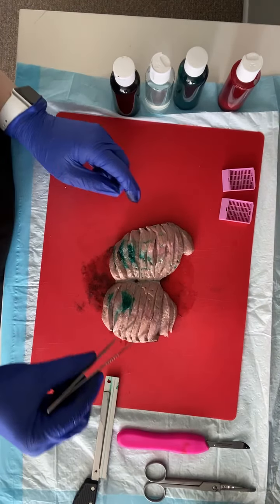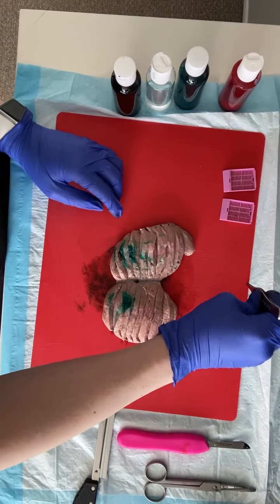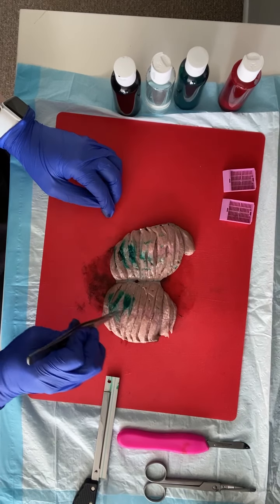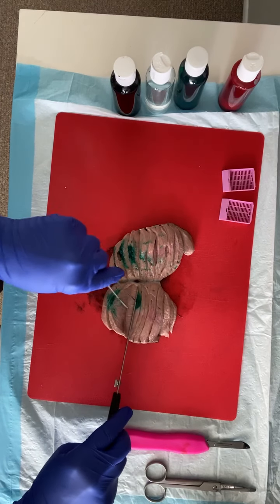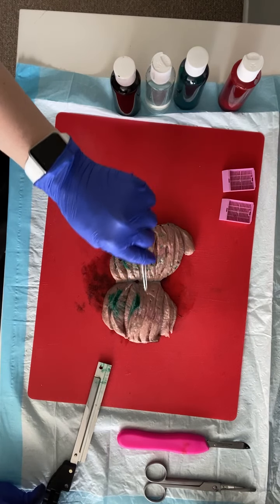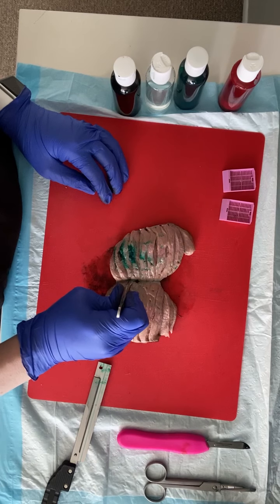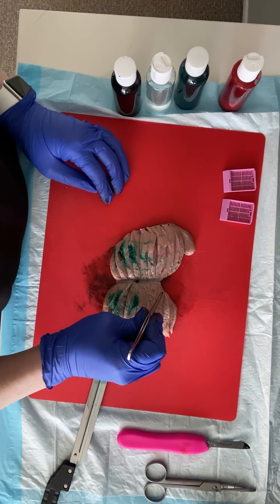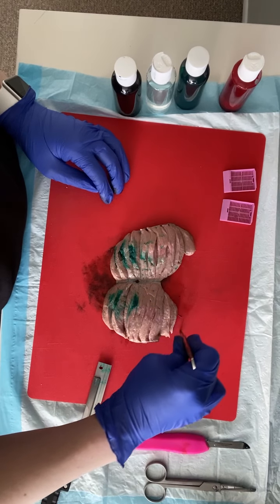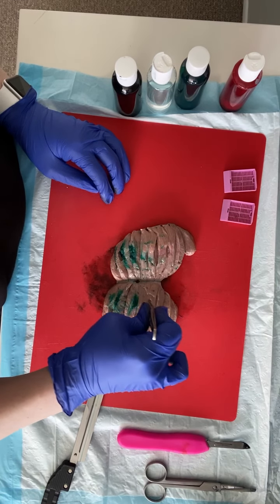We would measure three dimensions of our lesion. We would take the distance to our spermatic cord margin and also to our epididymis. Other important relationships: our lesion to the tunica albuginea — remember there's tunica albuginea all the way down through all of our serial sections, so make sure that's not your closest measurement; look at all of your slices. Important distances: tunica albuginea, epididymis, spermatic cord margin, and where testicular parenchyma goes into our epididymis. The epididymis attaches to the testicular parenchyma and the tail wraps around — we have head, body, and tail. Right at that little hilum is what's called our rete testis, and we can also describe that distance.